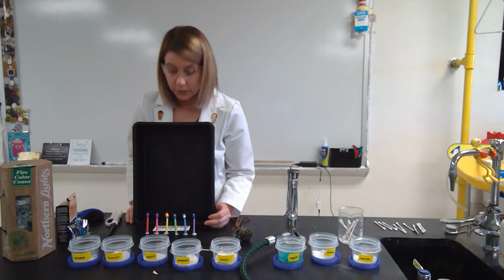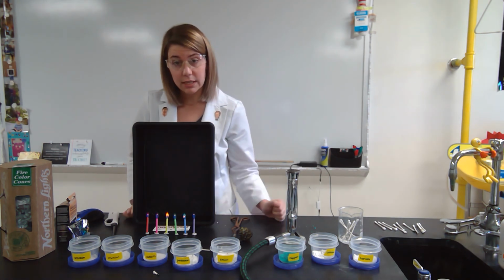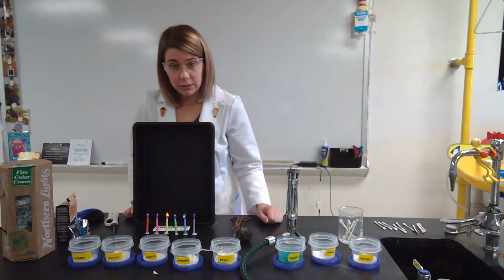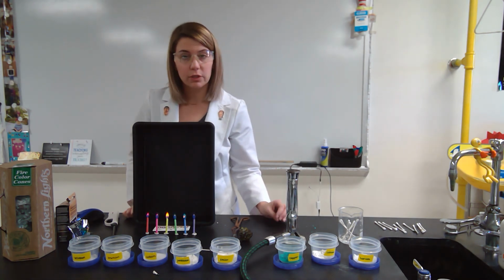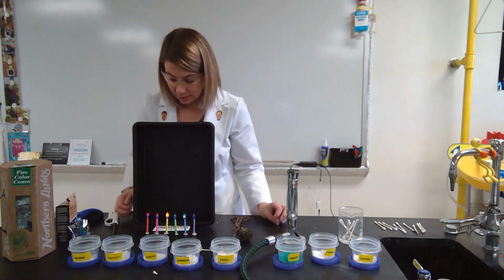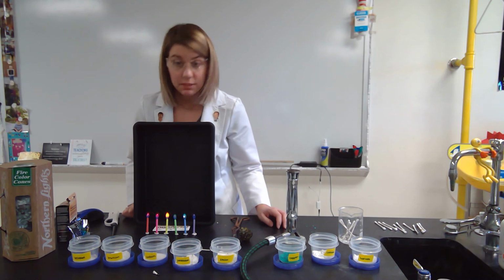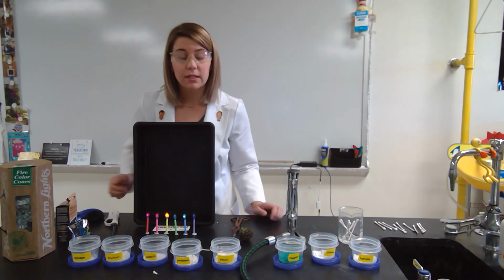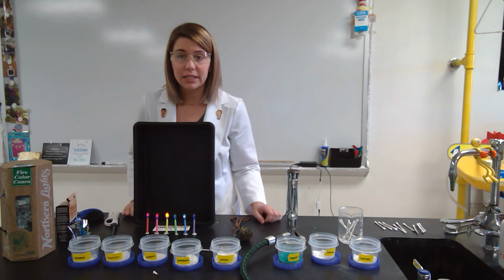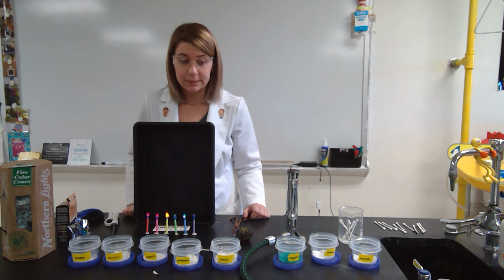The yellow candle is burning orange. I would assume that there is something like sodium inside of there, maybe calcium, because calcium does burn orange. But to get that yellow-orange, sodium is much better for that color. And then in the pink and the red, they both look the same to me, but they look like that red-violet color. So I would say for the pink and the red, these likely have lithium in them. It's possible they could have strontium, but they likely have lithium.